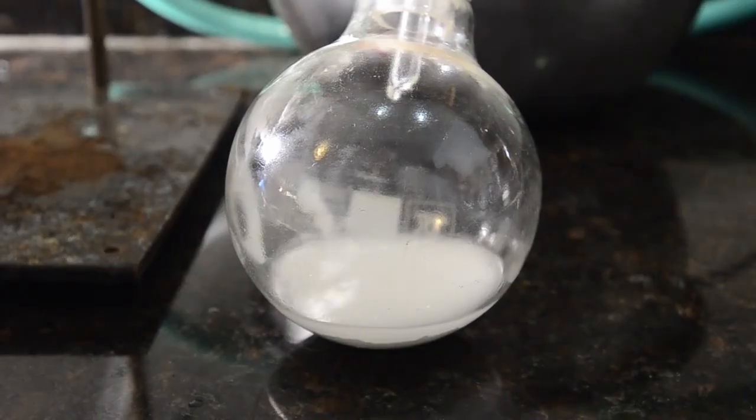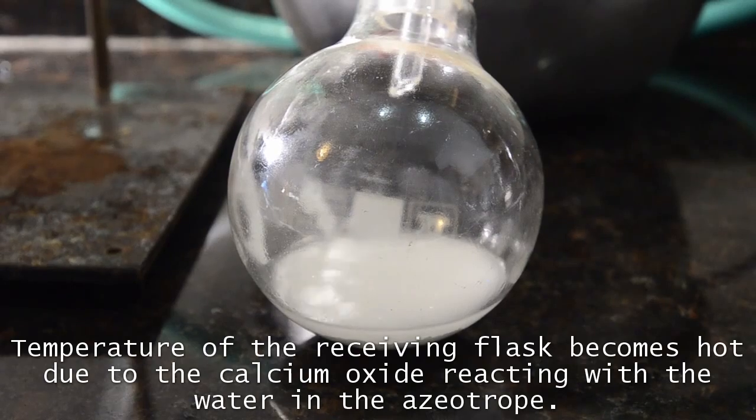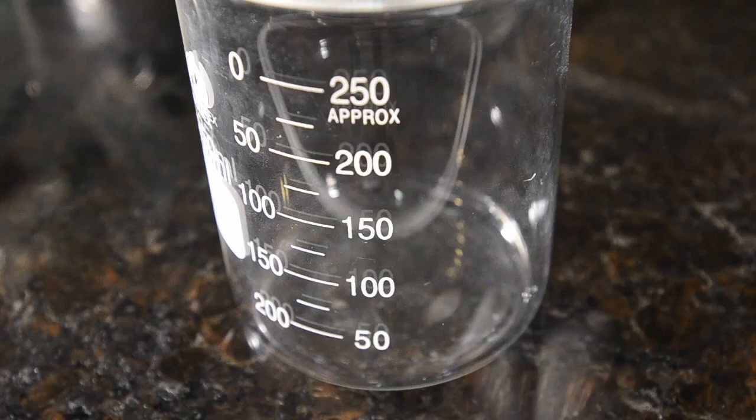With the azeotrope boiling off at around 80 degrees C, we've got a fairly quick distillation collecting, and the receiving flask is getting quite warm due to the reaction of the water with the calcium oxide. After a while we poured out the mixture from the receiving flask and allowed it to settle.